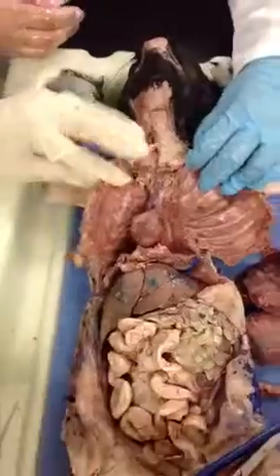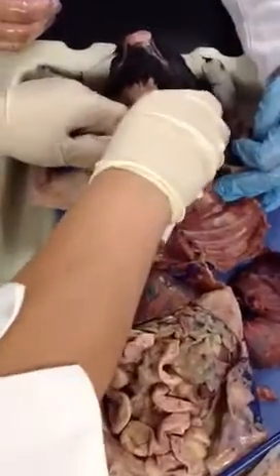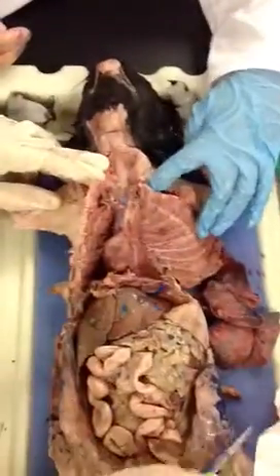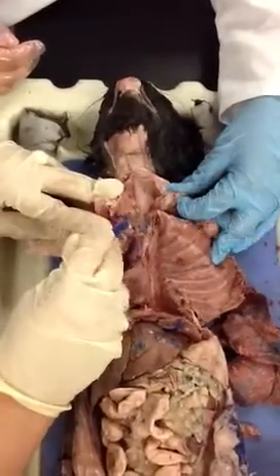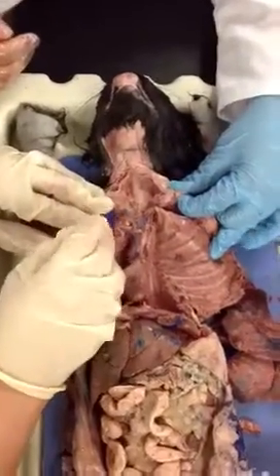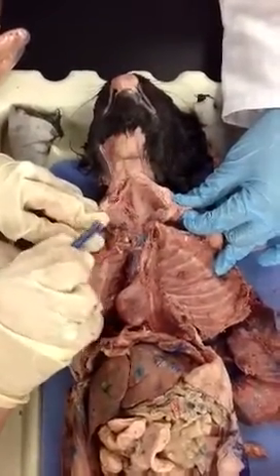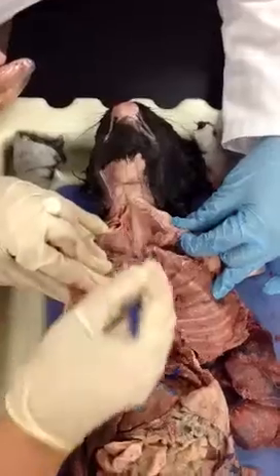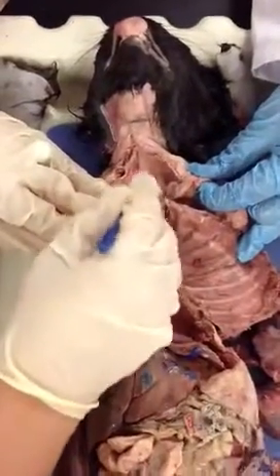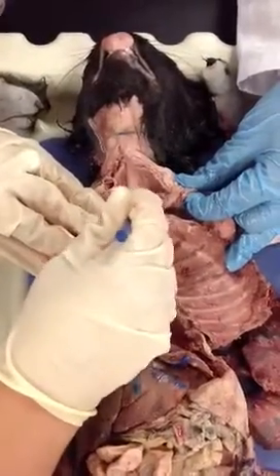Okay, so immediately after we open it up, we're going to see that trachea. You see the cartilages of the trachea? Yeah. You see it? This is the trachea. These are the cartilages that form the trachea. Now parallel to it, we're going to have the carotids. So immediately I see this blood vessel. This is going to be my right common carotid. You see it? So then, I'm going to continue to dissect. This is how I want you to dissect until you properly learn how to do it. Just separate it with the probe, so that way you won't sever the blood vessels.